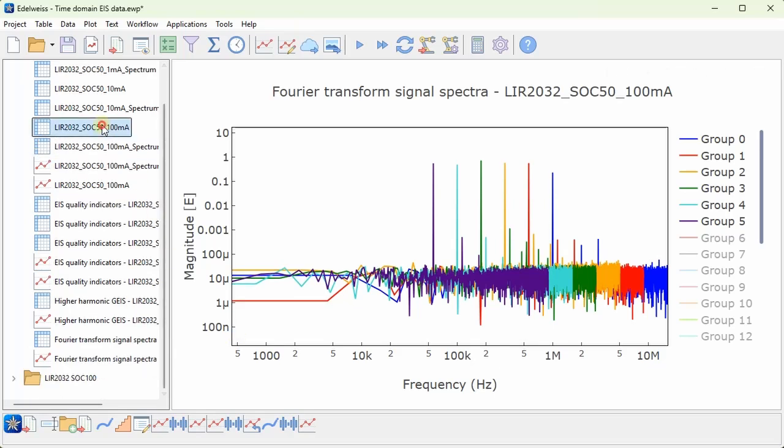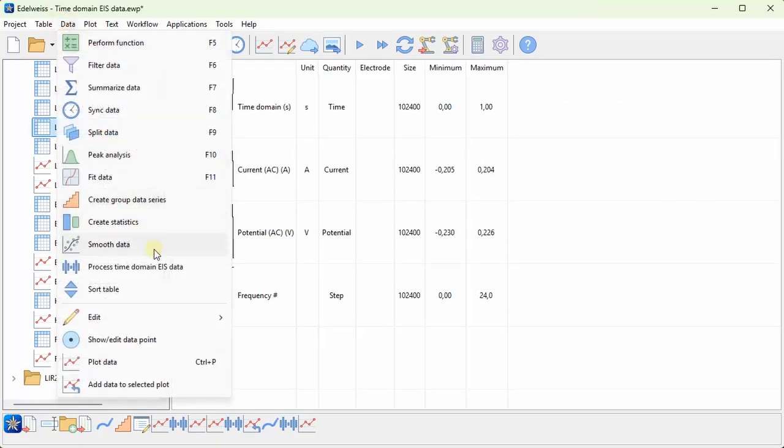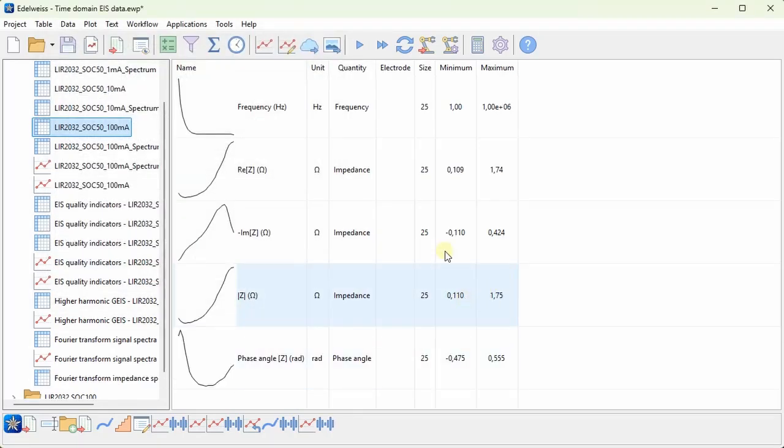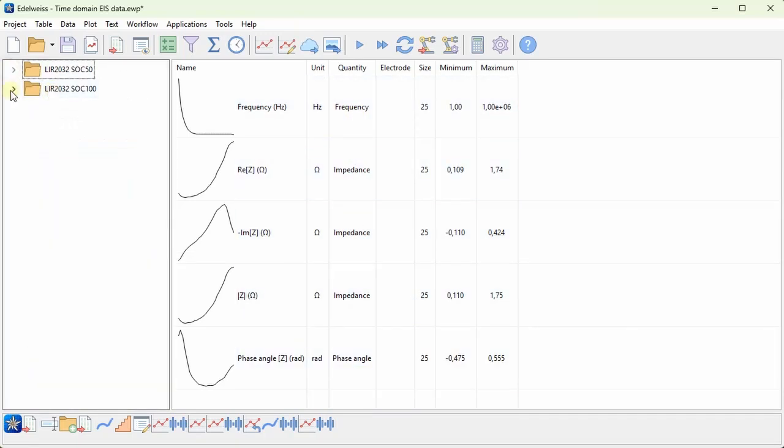There is one more option in the dialog that we've looked at, and that is calculate full impedance spectrum. Now for this data, this doesn't make much sense. This will just again calculate the impedance spectrum for this data. But to demonstrate this feature, I have some other data loaded.